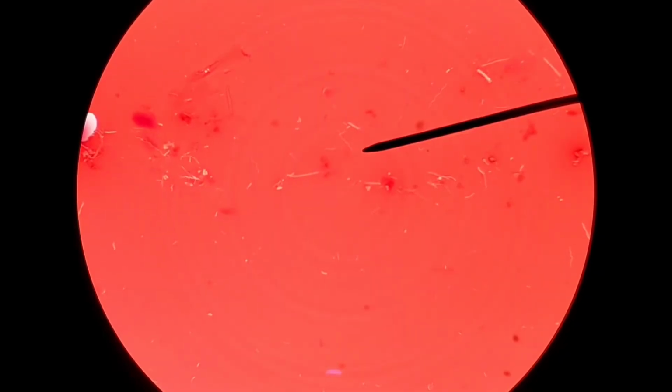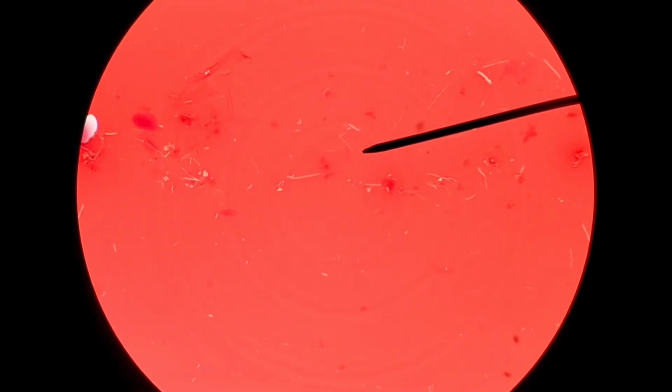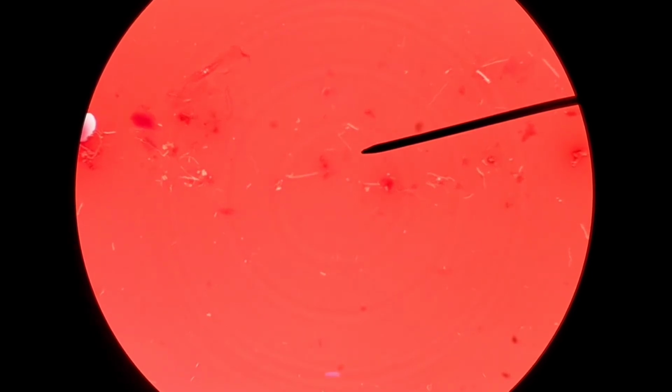All right, so we're taking our look through the microscope at a view of a negative stain taken from an oral cavity. Depending on if you can see this through the camera, at the end of the pointer, there's the black needle-like device in the field of view here. I can see a spirochete as just a wavy little snake-like line.